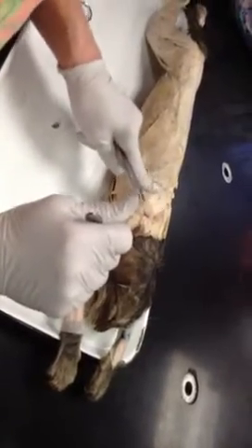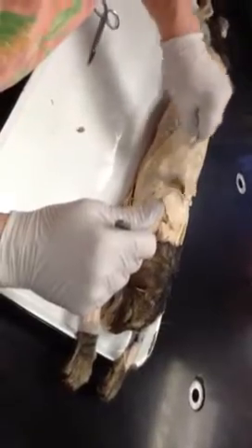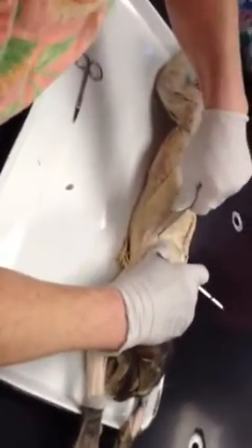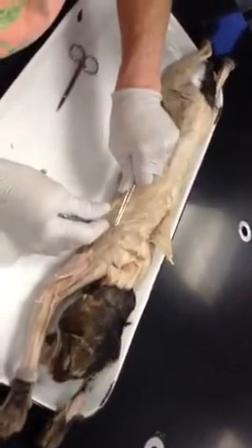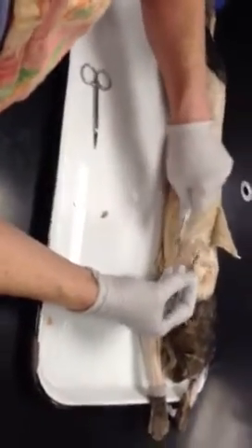And the spine is right there. What I'm going to do is move this back. And now I'll be able to see the infraspinatus right there. So what's on one side's on the other, always the same. Yep.